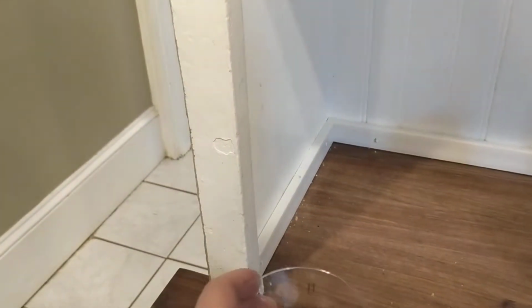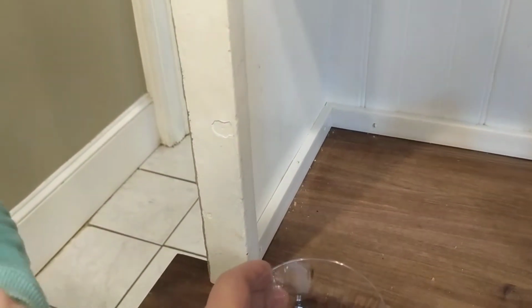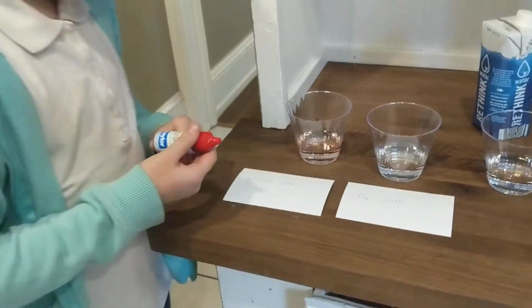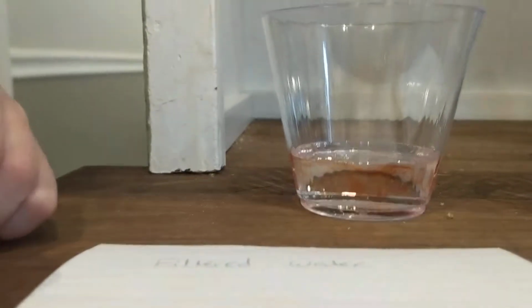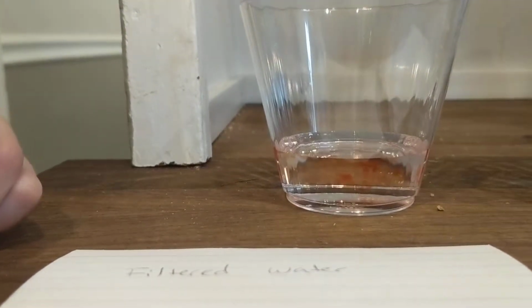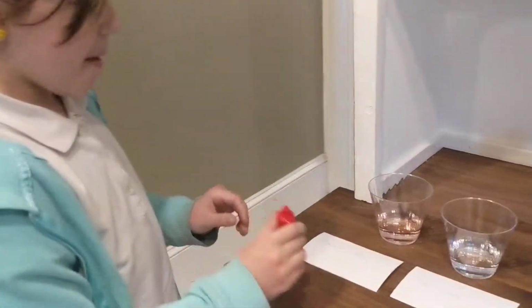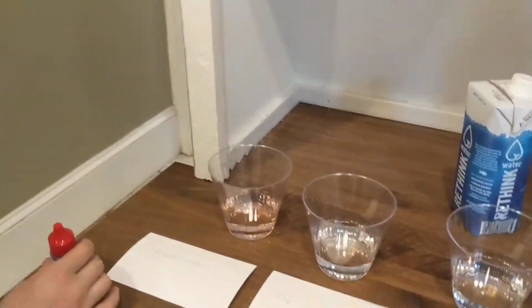And what are we testing when we test this? We are testing how much acid is in each clear drink. Okay, so we're testing pH levels, and the pH level tells us what? Acid and what? Alkaline. Oh, alkaline. All right. Okay, so we got the first one. Let's go ahead and start with the second one.